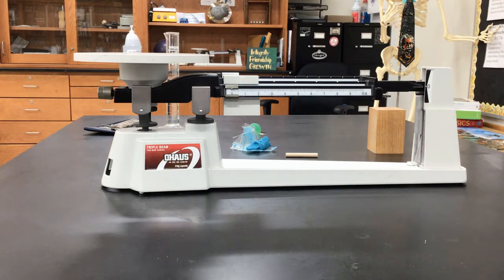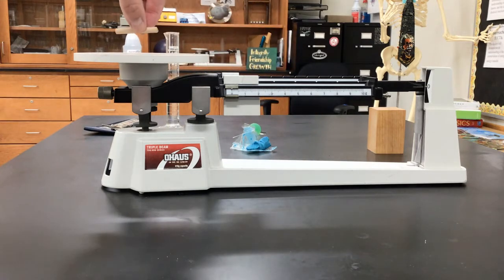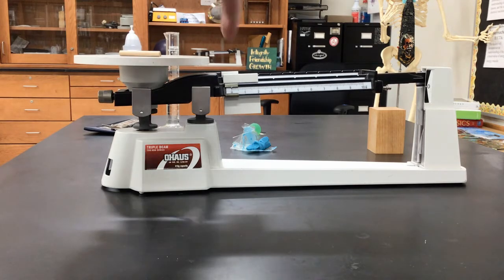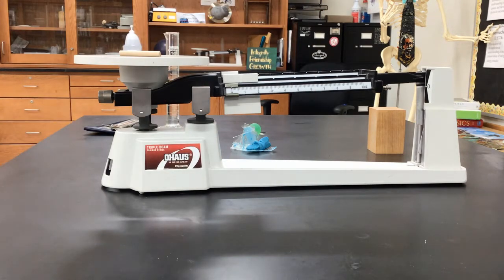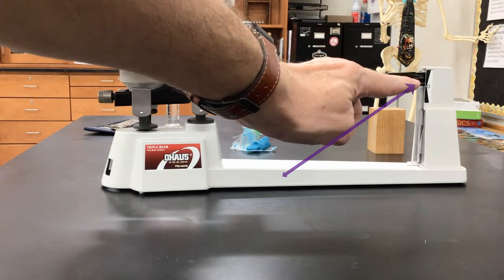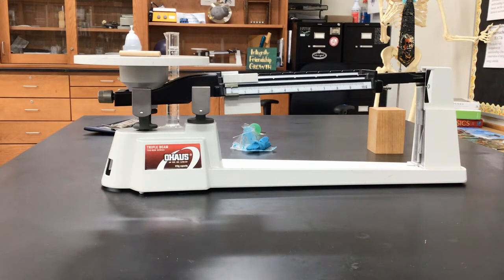What you need to make sure you do is put whatever you're measuring for mass on the scale, and you see that the arm goes up. Now you simply move these little dials back and forth. This one right here, you move a little bit to the right, and you keep moving all these. You keep making adjustments until this arm goes back down, and that point right there matches that point right there. They line back up. Then it'll be zeroed out. It will be balanced. Okay? Then you will have a good reading.